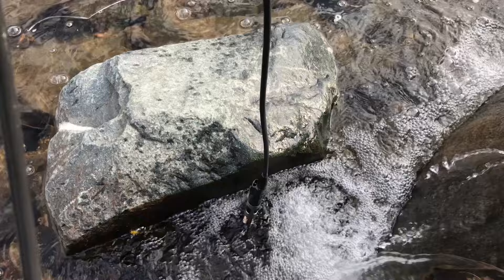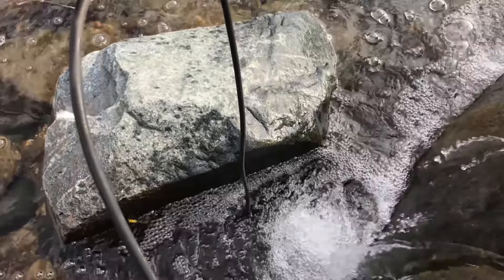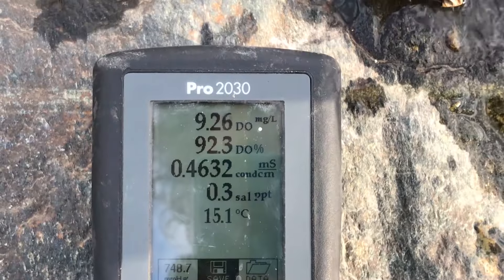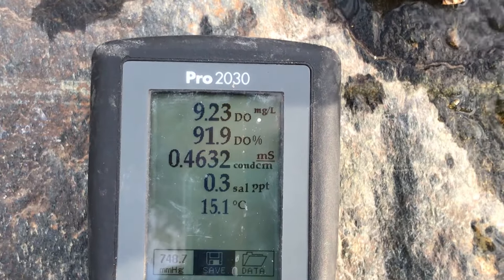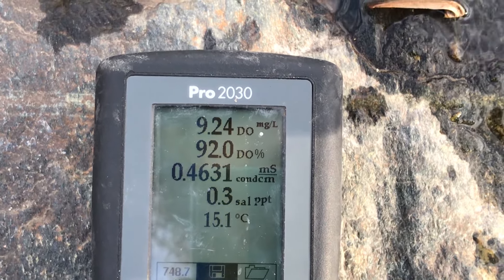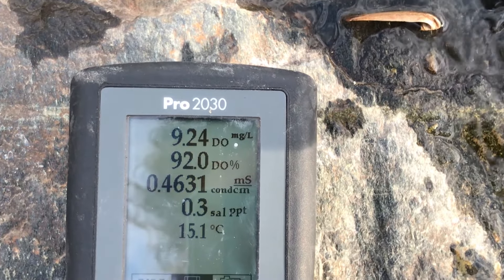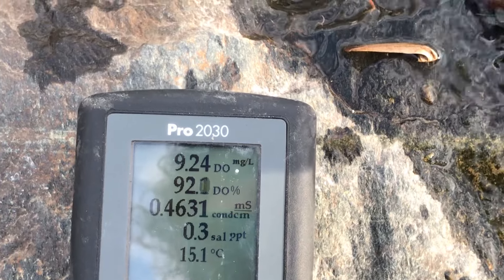Earlier I said that moving water is more likely to have more oxygen, and here we are at this little waterfall — I just couldn't help myself, so we stopped to check the dissolved oxygen level here too. As you can see by this little waterfall, we've got a much higher level of dissolved oxygen: 9.22 milligrams per liter compared with just barely above 5 milligrams per liter a little ways upstream.